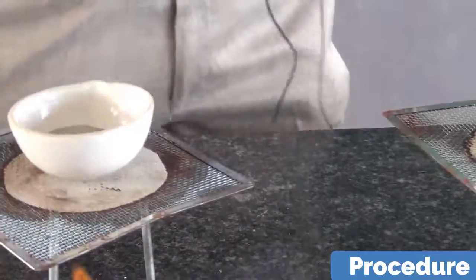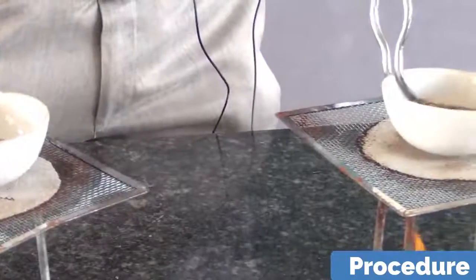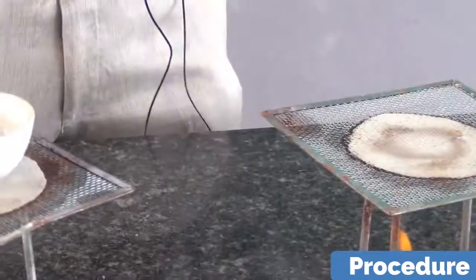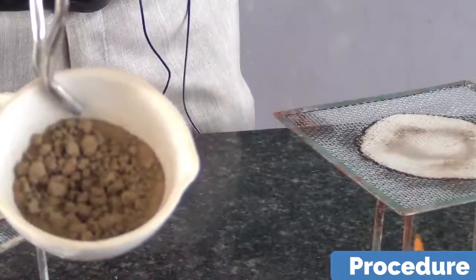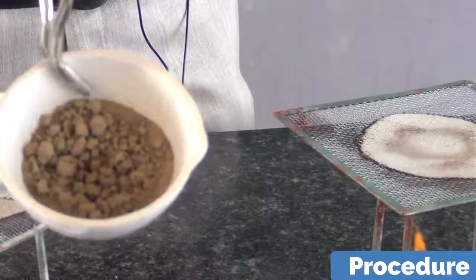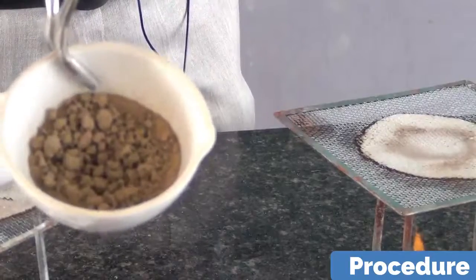Now similarly, for the loamy soil, after heating it for 10 minutes, you can see the color. Observe the color. This color should appear after heating it for 10 minutes.